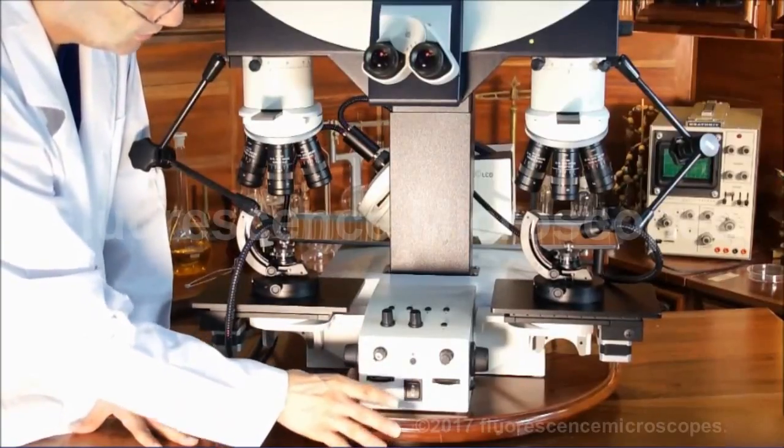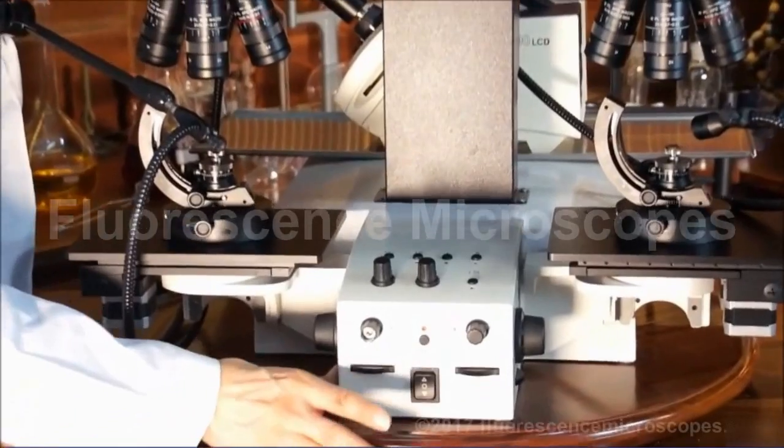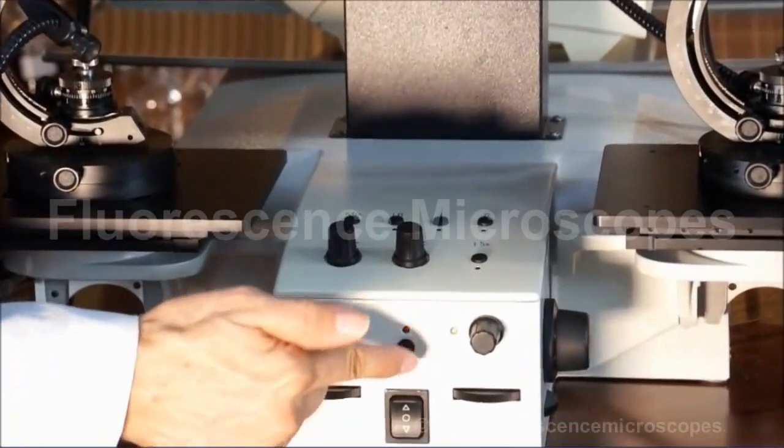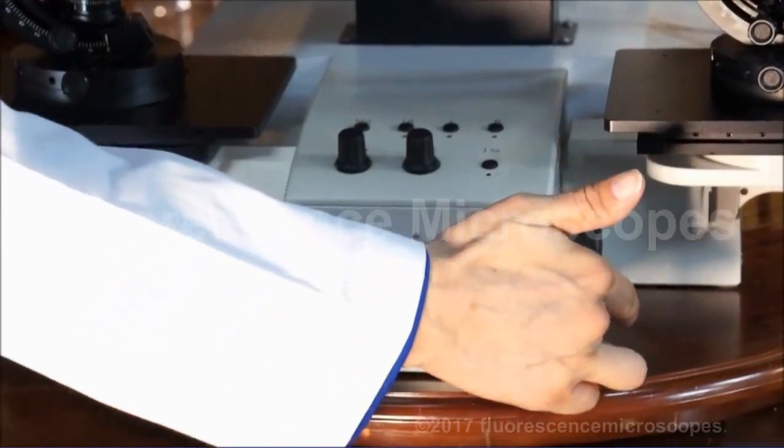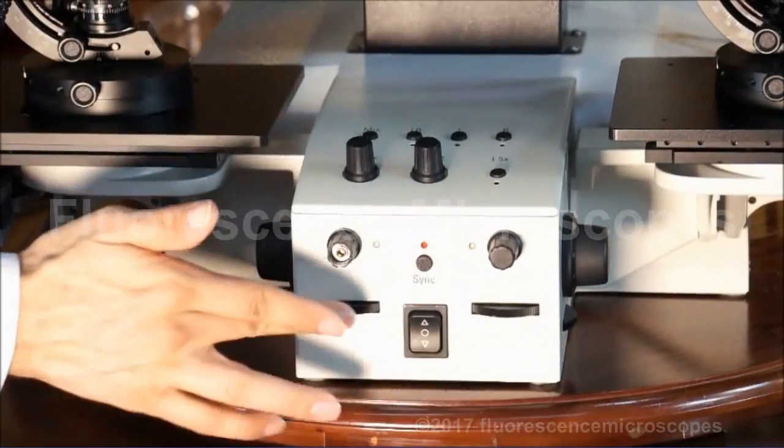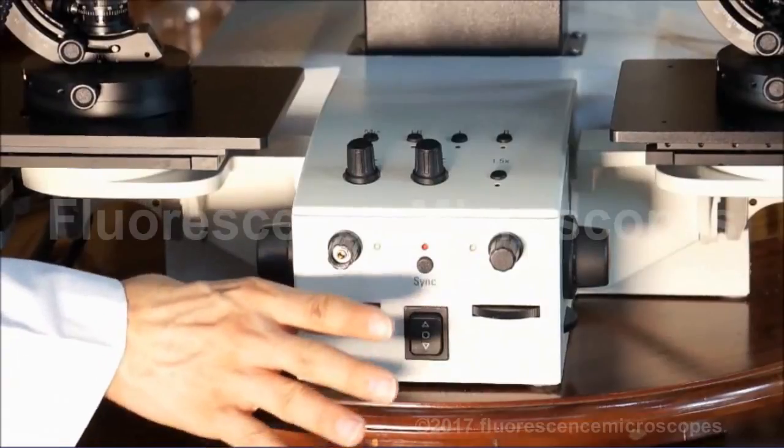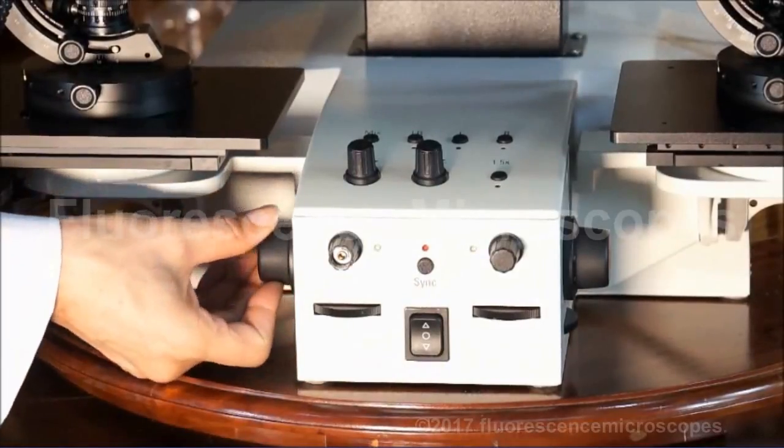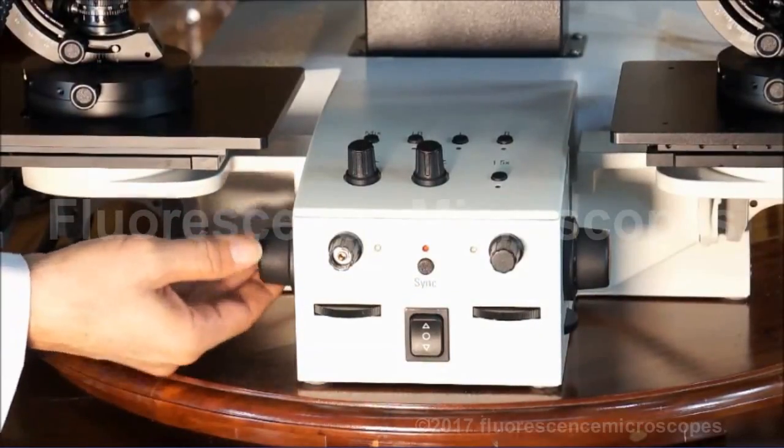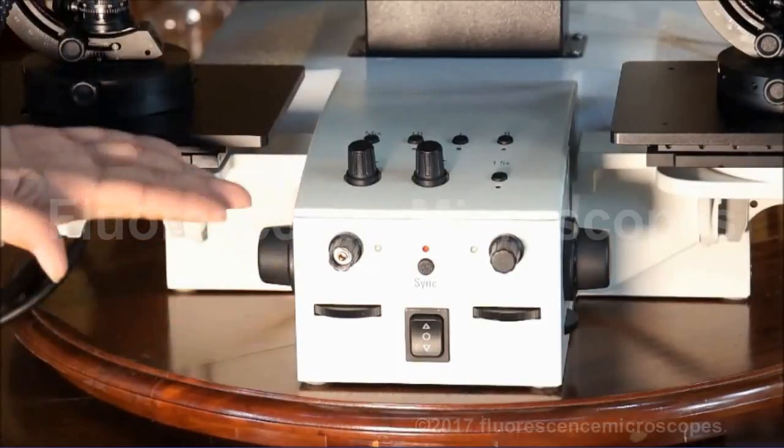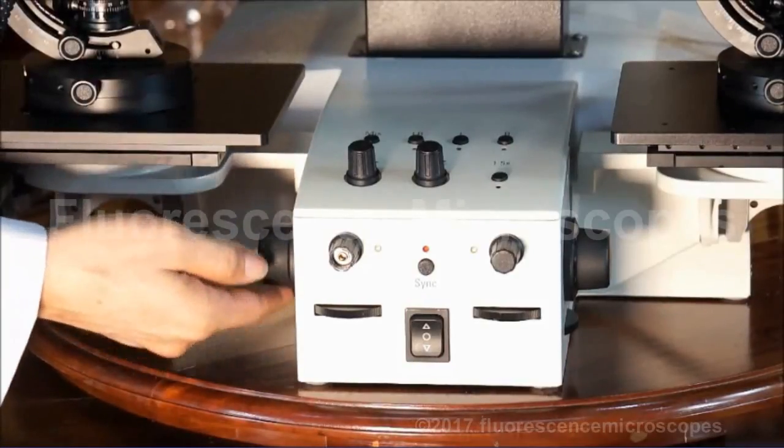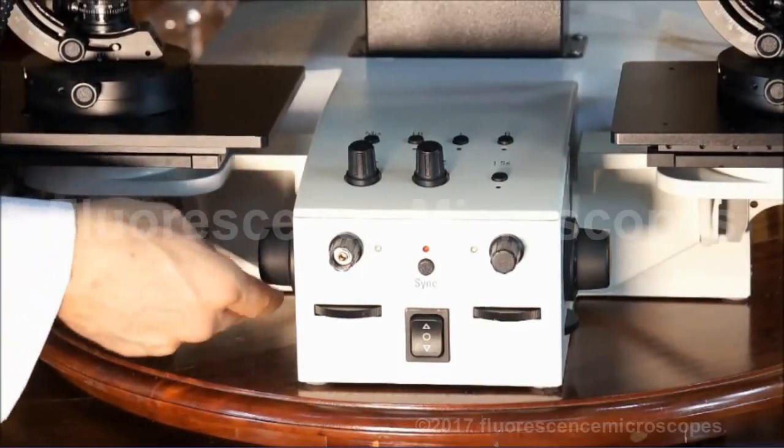Here's my Y movement. I'll turn off the synchronization, so then I'm just moving one at a time. This is my focusing. A little hard to see, but it is rising, and it's lowering.